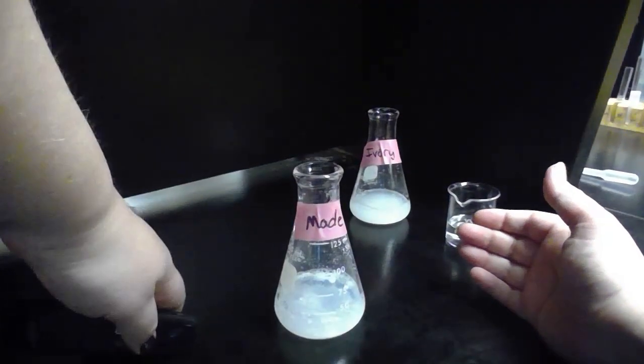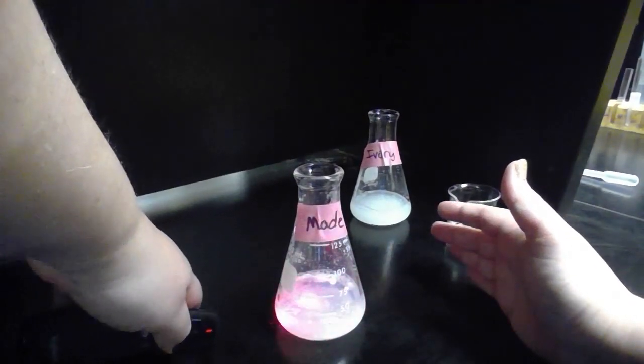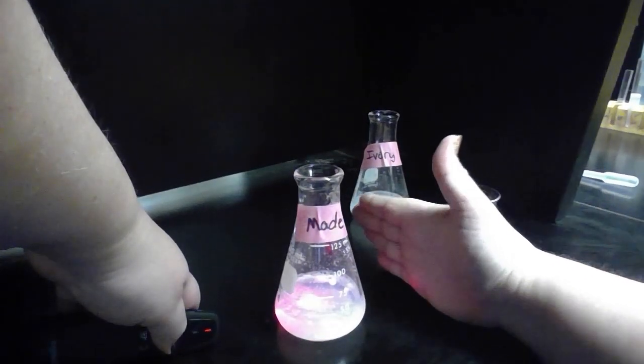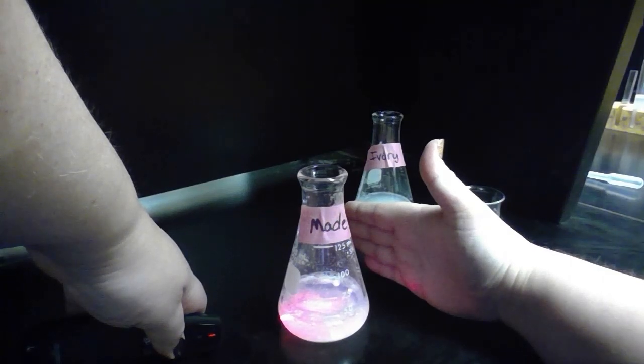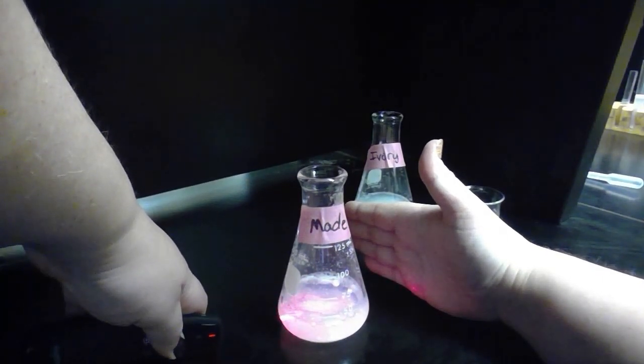We're going to do the same thing for our made soap solution, our sample. This one again, we have a little bit of pass through. It's not quite as cloudy and doesn't disperse as well. There's a little bit of pass through. You can see it coming out the other end.